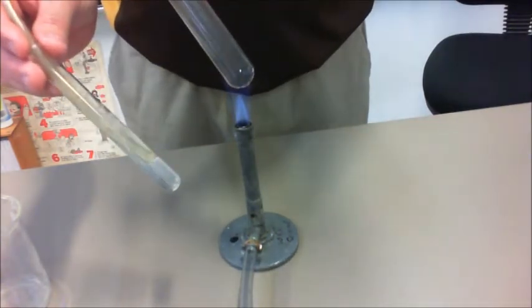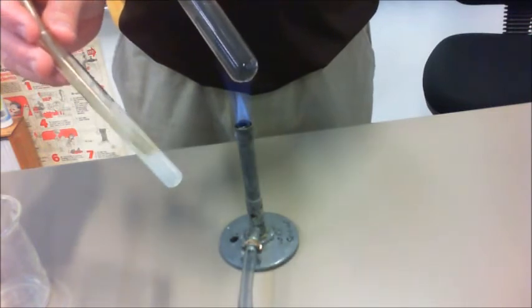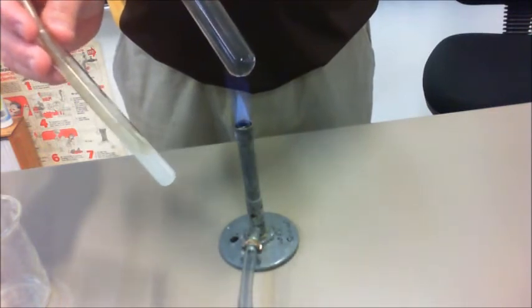Now, you can see there, so all of the copper carbonate has gone black there, and you now see that you have a very cloudy mixture.